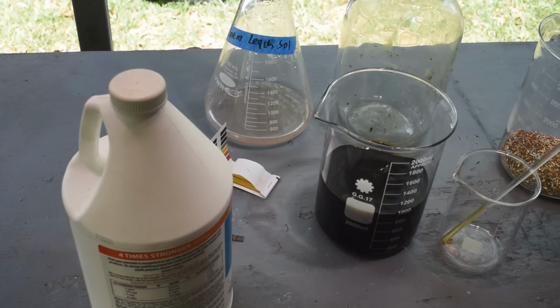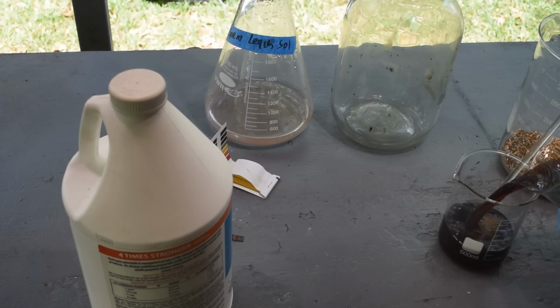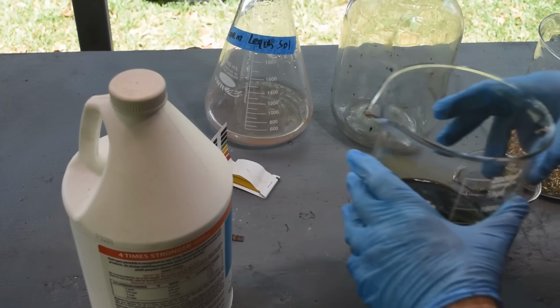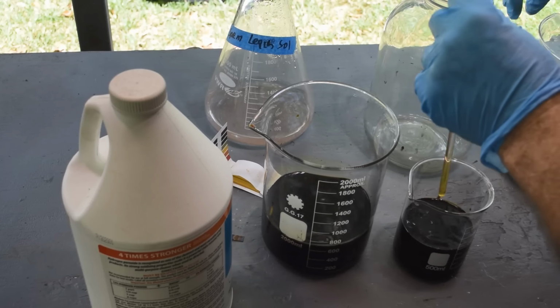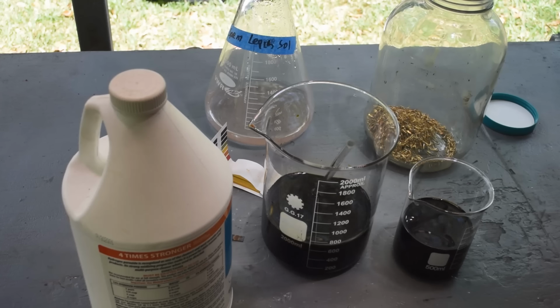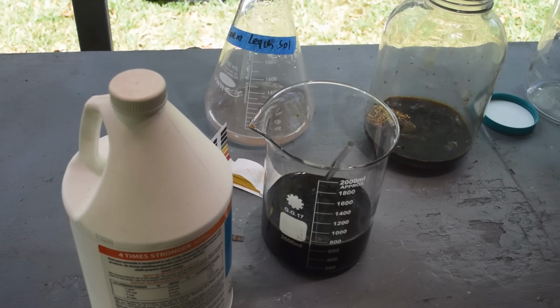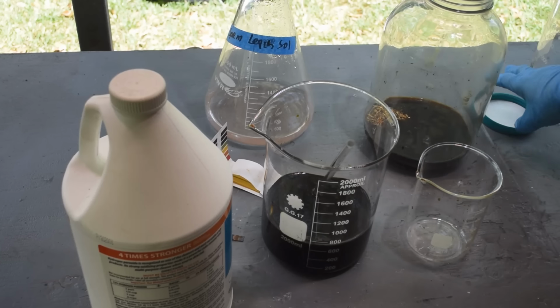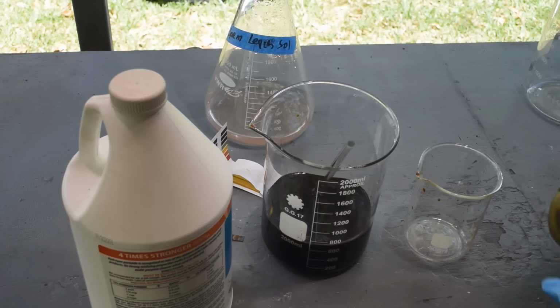So let me measure out 300 milliliters, roughly, of this stuff. This lovely purple liquid. All right, that's what we're going to use for our first treatment. Right there. And put the pins in here. All 300 grams of them. Come on, all of you in there. Everybody in the pool. Let's put this in. All right. Cap it up. And we'll go put it on the rock tumbler for 15 minutes.